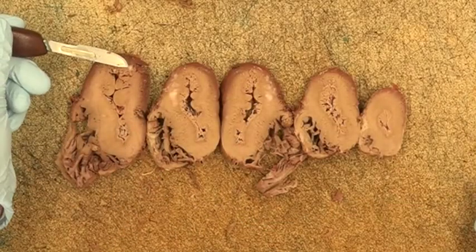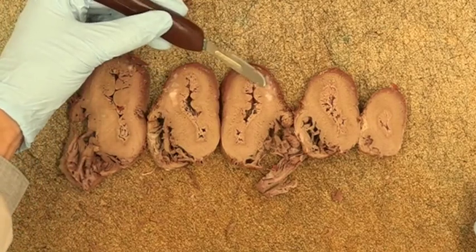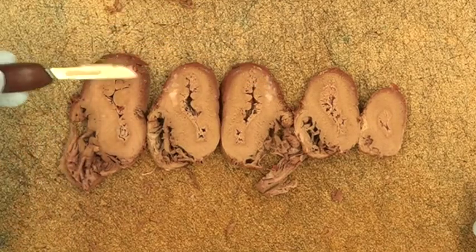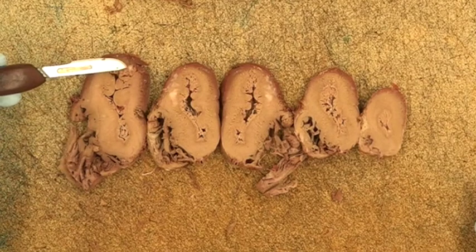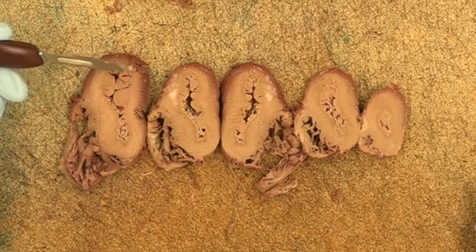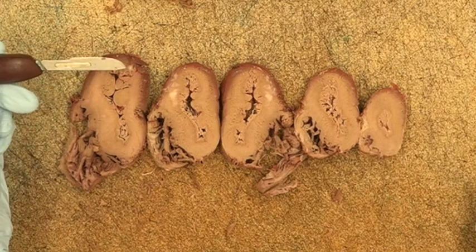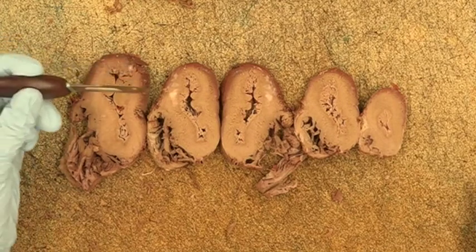This specimen has concentrated white discolorations that are indicative of collagenous scarring within the myocardium. A complete description of the scarring process is included in the laboratory guide. It is usually an indication of a healed myocardial infarction. There is no way to tell how long ago the myocardial infarction occurred.